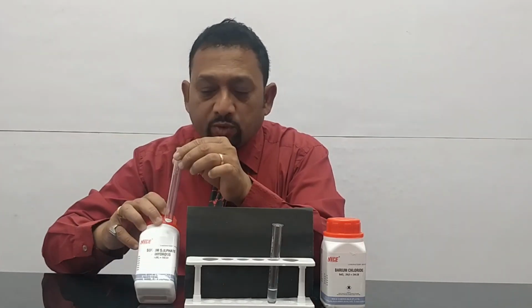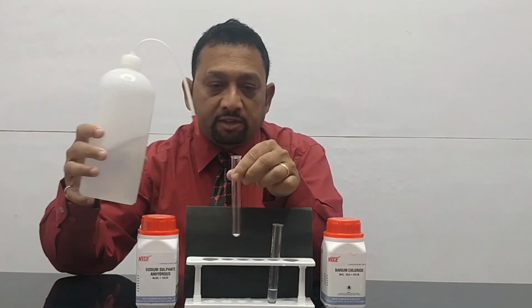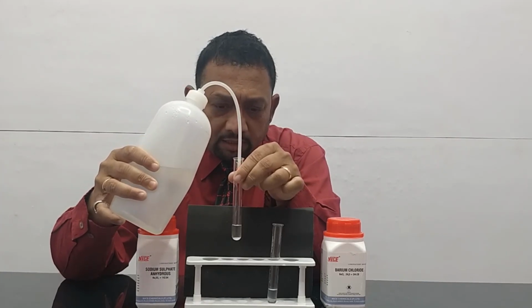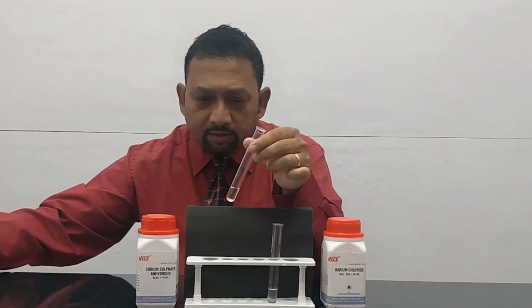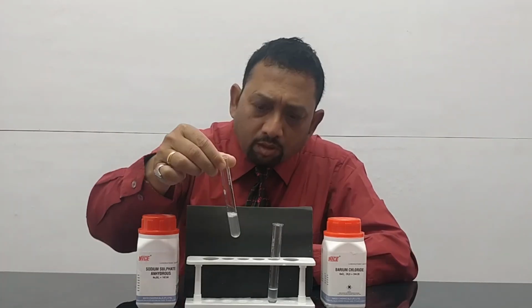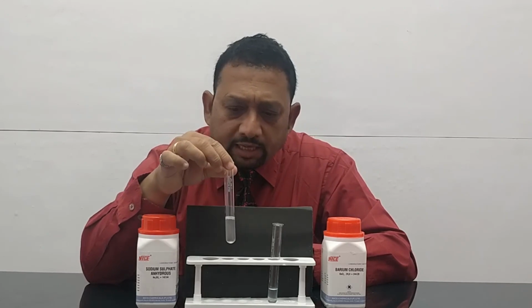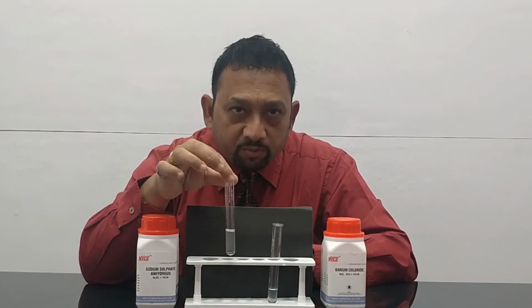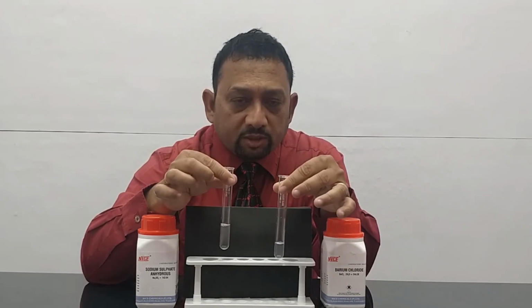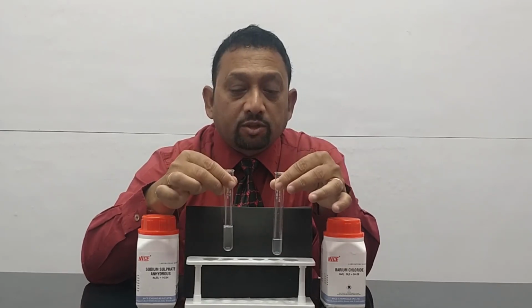Now, we'll take the sodium sulphate and we'll do the same thing. We'll dissolve it into some water, and then we'll make a clear solution out of it. So now you see you have a little residue at the bottom. Let this completely dissolve. Now you can see this is also completely dissolved. There's no residue. Now, in a precipitation reaction, two soluble salt solutions will form an insoluble salt.